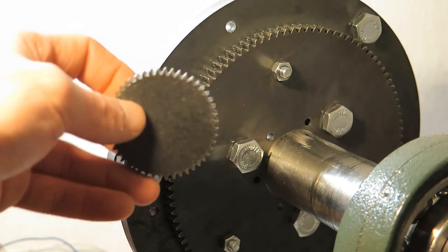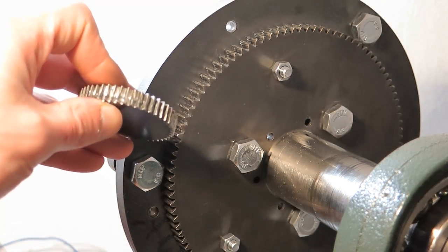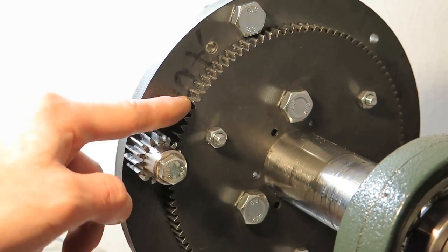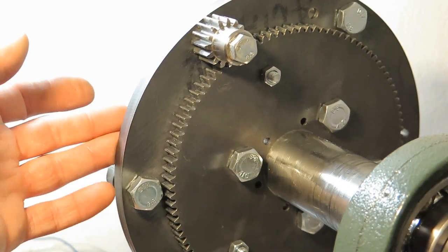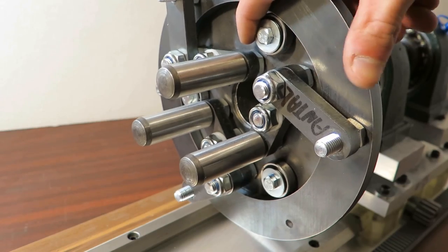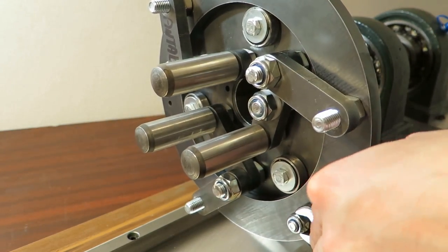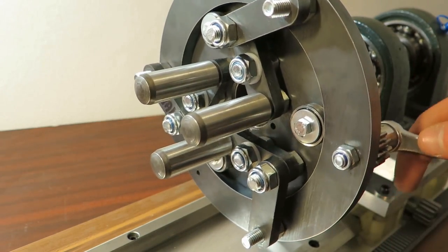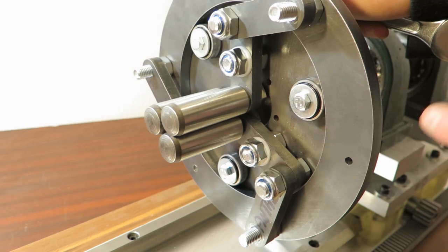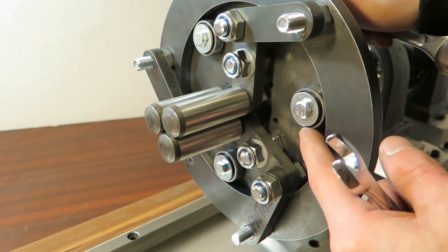And I was testing it by making this thing. This is module one, this little piece. This was just a test of how the profile will look like and stuff like that. It's pretty terrible basically. And this is module 1.5, and it works quite well. Also, you can see that I am using regular bearings here, but they seem to hold quite well. If you tighten this ring, which is held by these bearings, or its center position is held by these bearings, it basically aligns itself. So there should not be very big force.